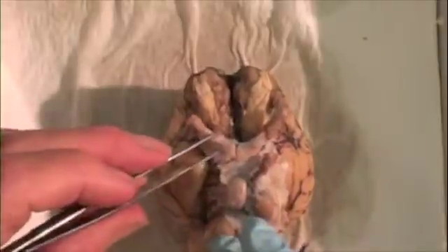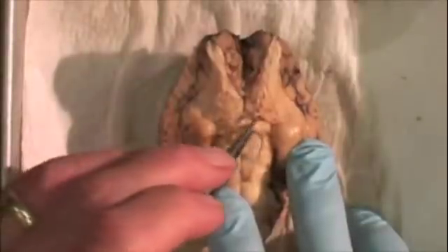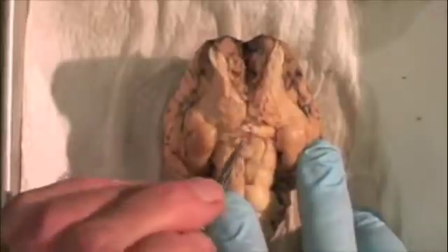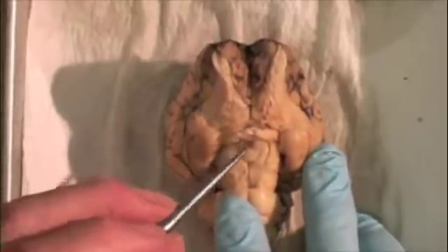This is an optic nerve broken when the dura was removed. Not easily seen are the optic tracts and the optic chiasma, where the optic nerves cross. Here is the mammillary body, the infundibulum which appears as a hole, the cerebral peduncles, the pons, and the medulla.